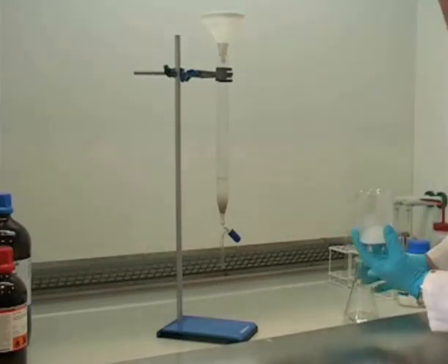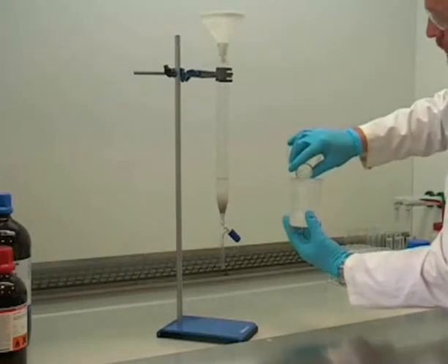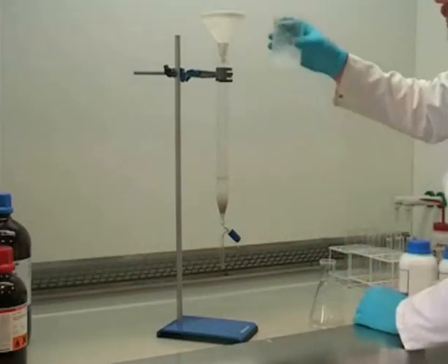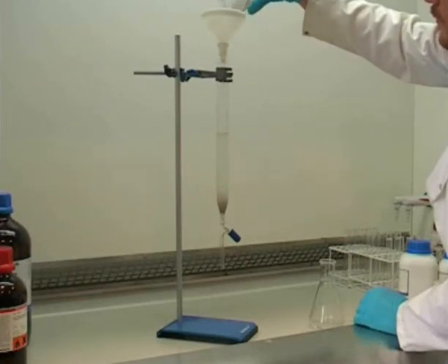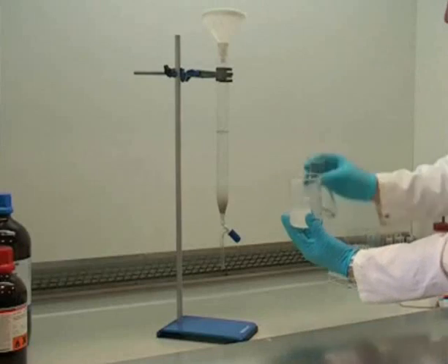Where appropriate, more eluent should be added to reform the slurry to assist with pouring. You may need to do this several times.